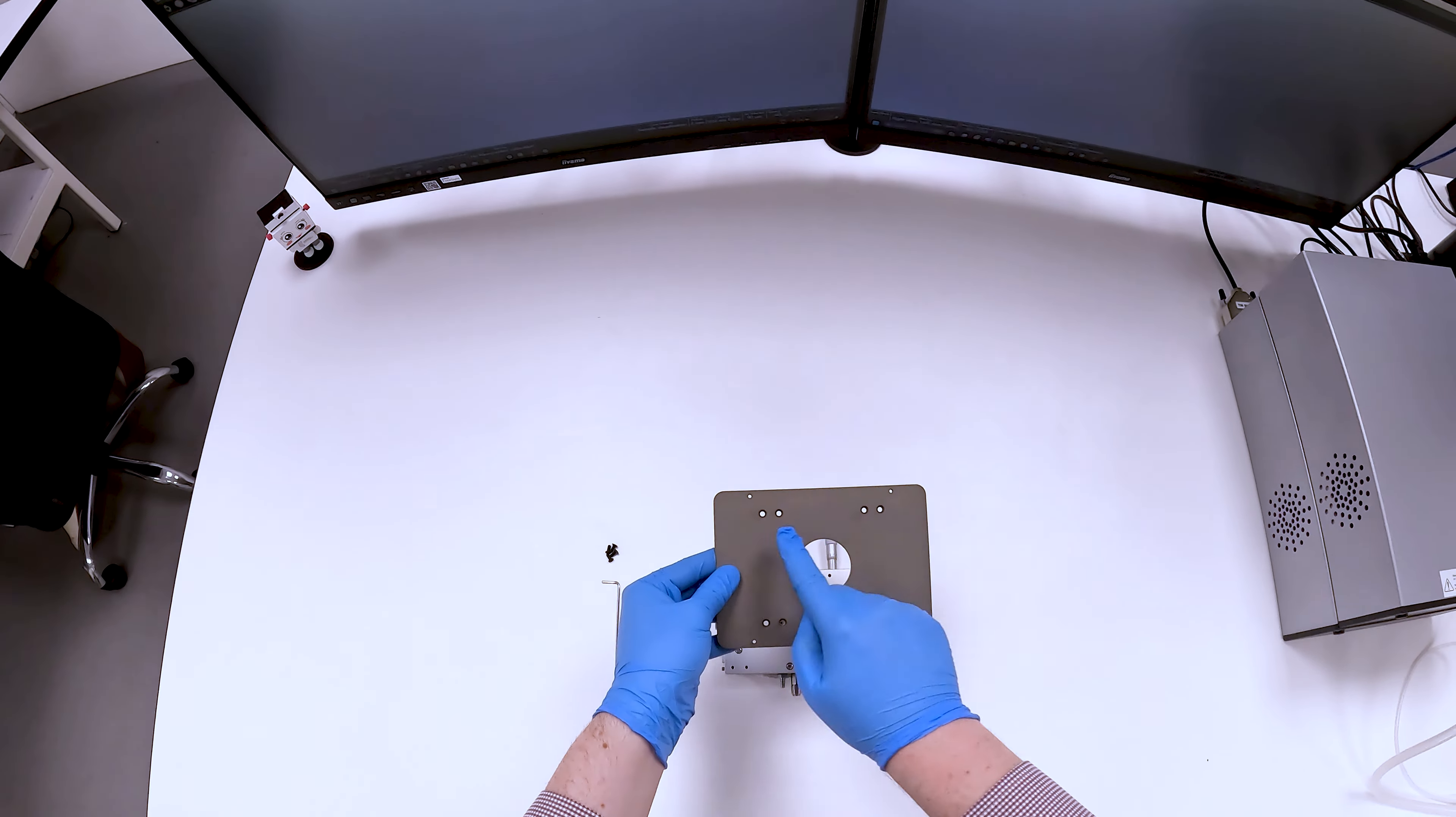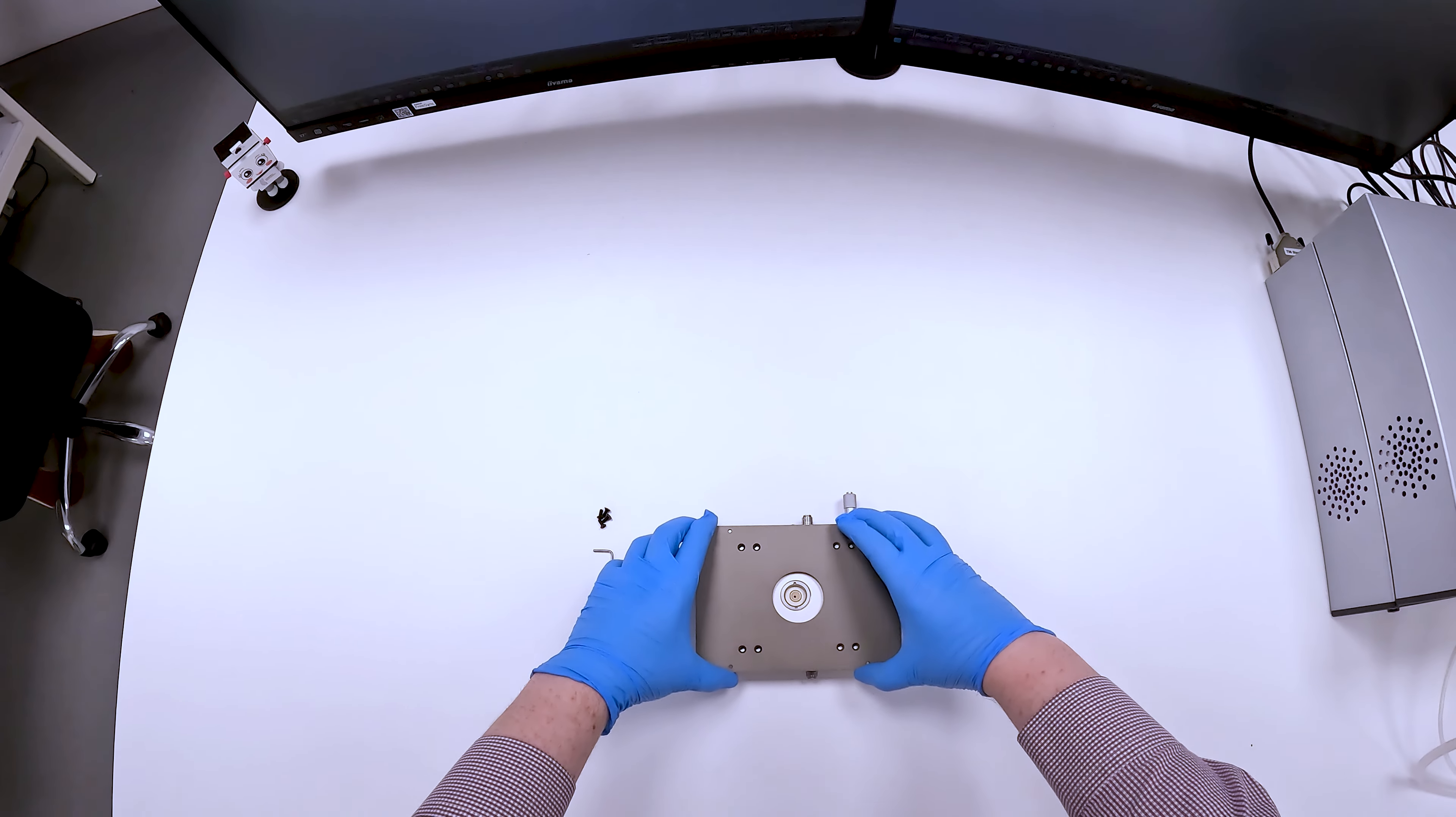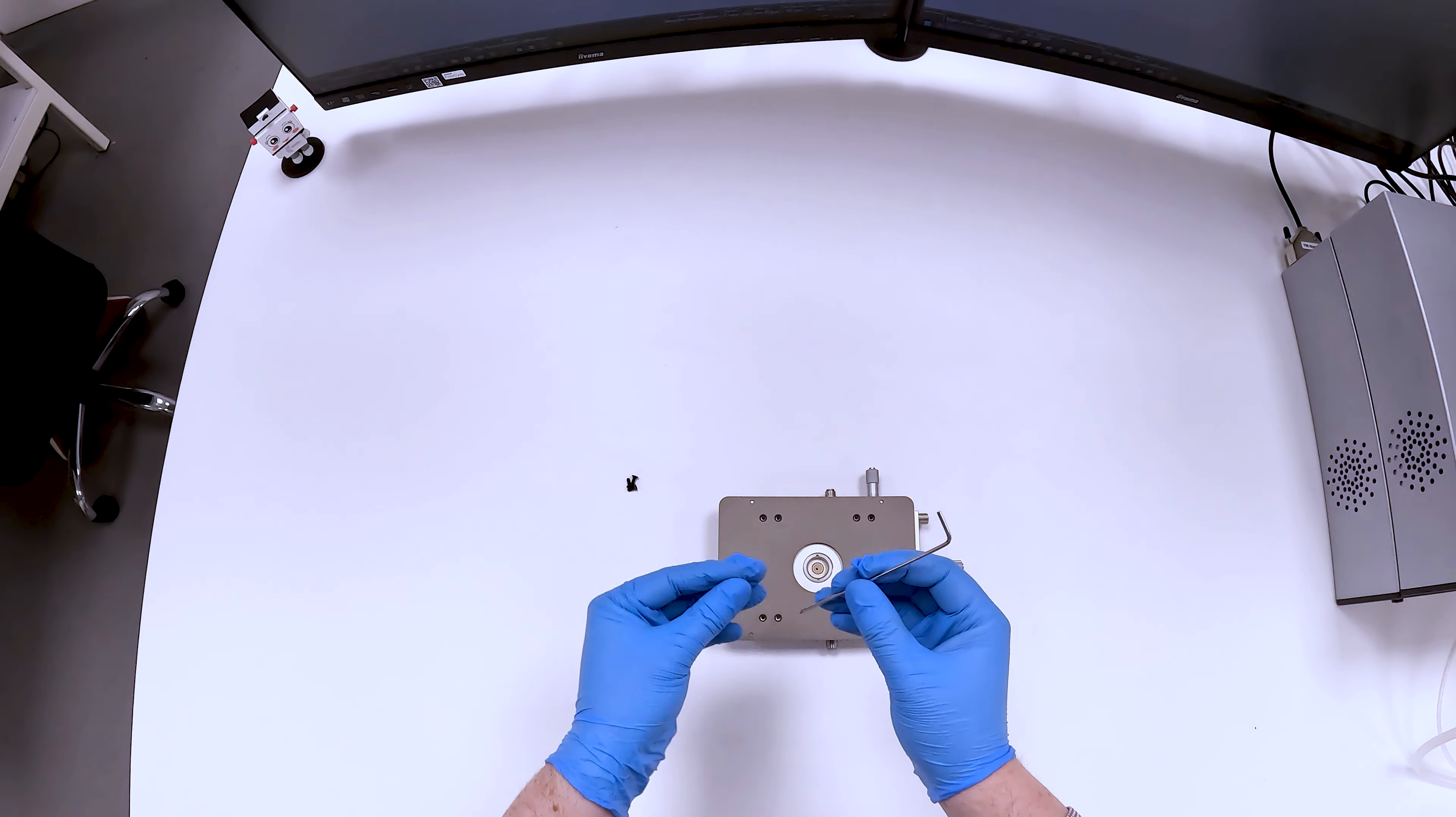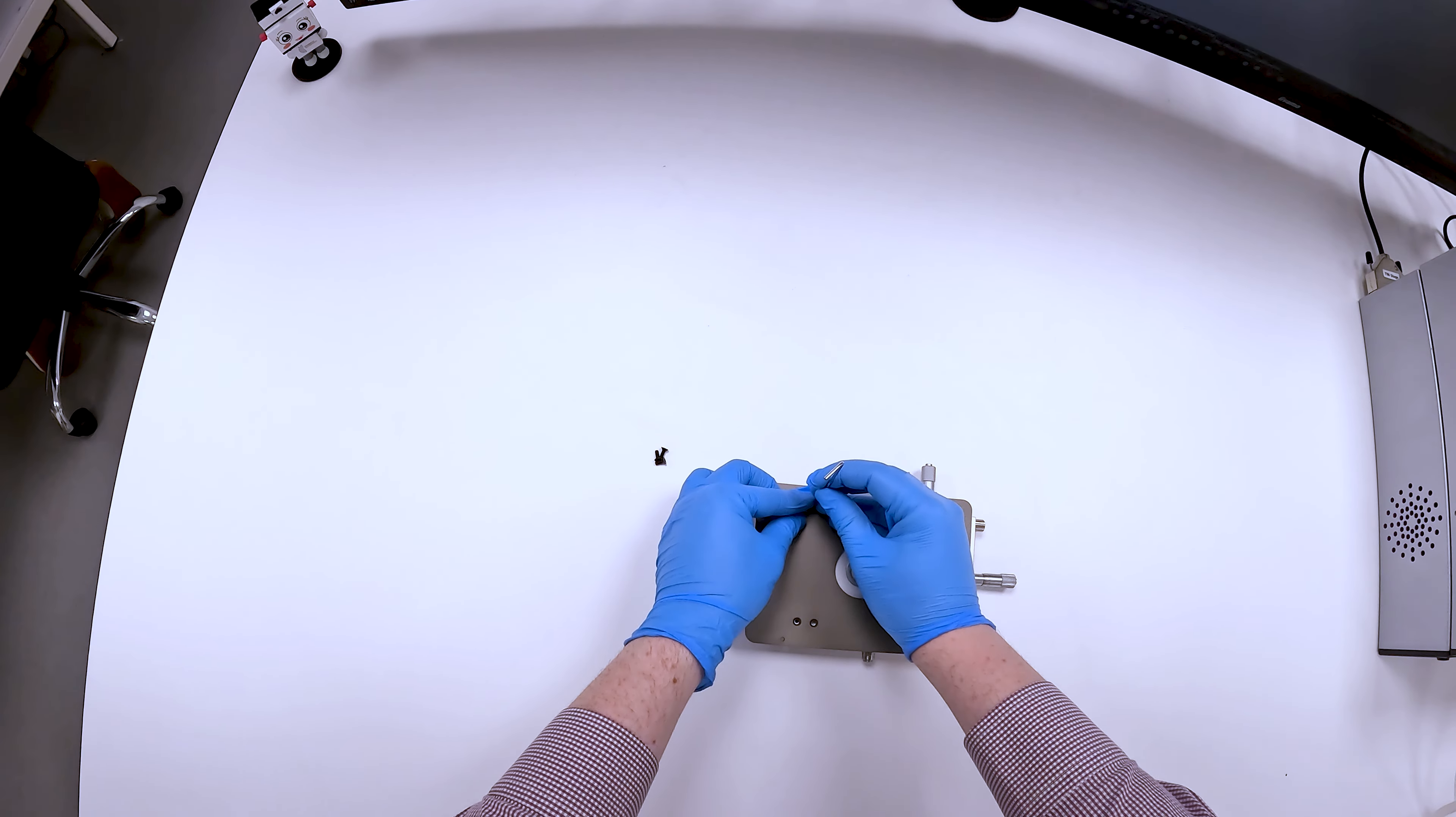To allow the stage to be secured under the microscope objective, it should be screwed to a custom mount designed to fit the motorized stage of the RM5. This mount is provided by Edinburgh Instruments. The Linkam stage can now be placed on the motorized stage of the RM5 underneath the microscope.